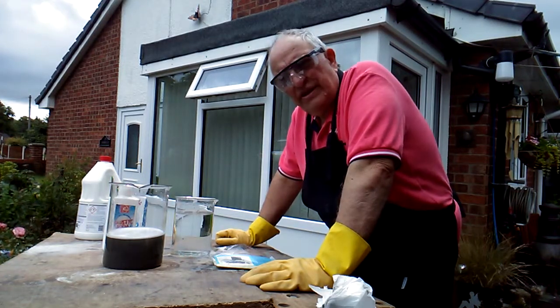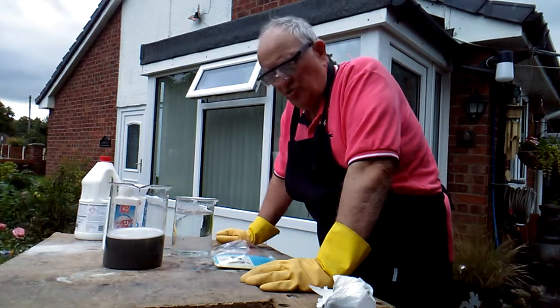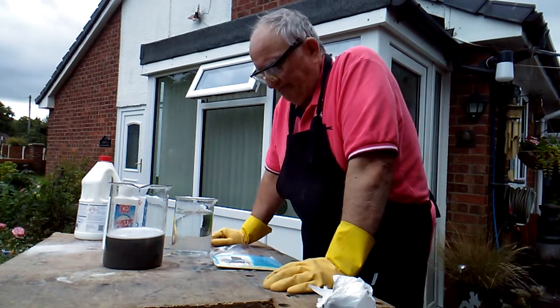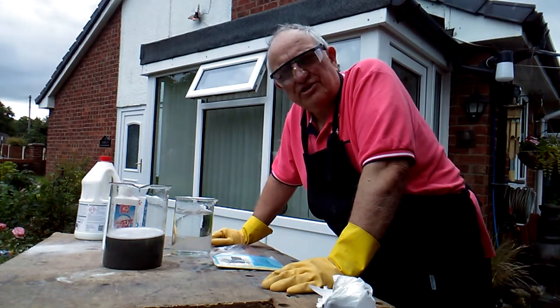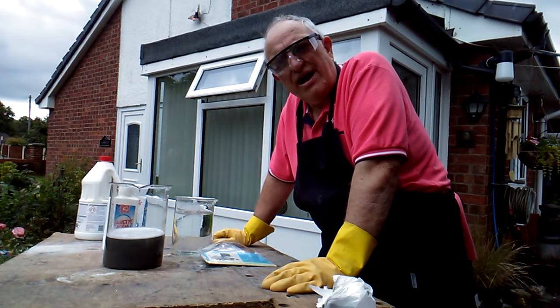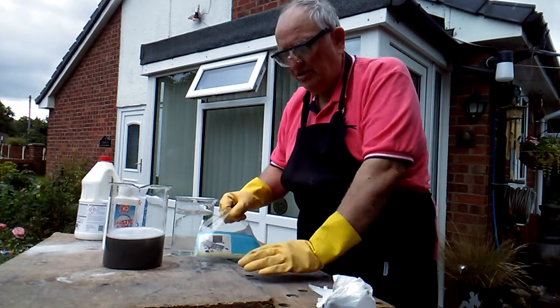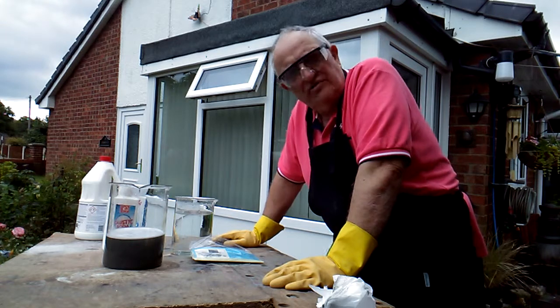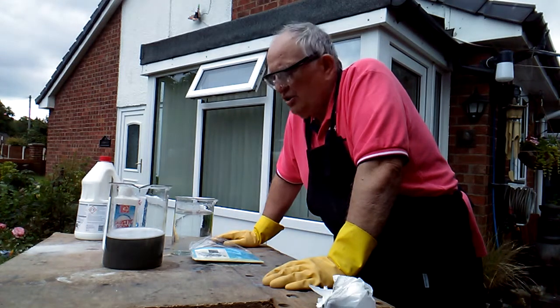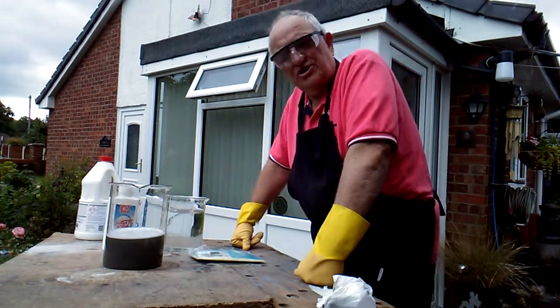It's quite a long process. I can see bits floating in there so there is something washing off the negatives as you go along — there may be a little bit of residue I'll try to recover. I'm not expecting to get a great deal of silver out of this; I've used about a quarter of my negatives just to see how much I get from 100 grams. I want some idea of yield. But I didn't pay anything for these films now — I spent the money years ago. Any silver I recover is profit, because these would just be thrown away and burnt. So it's good fun and good science.